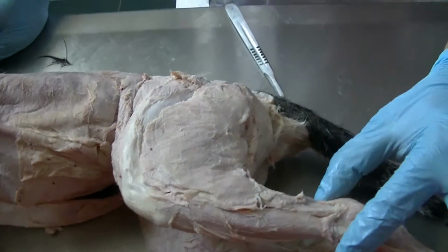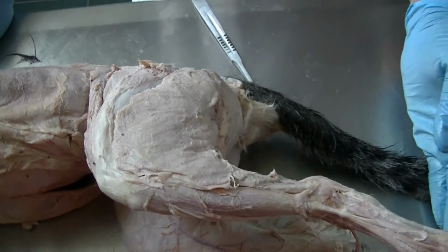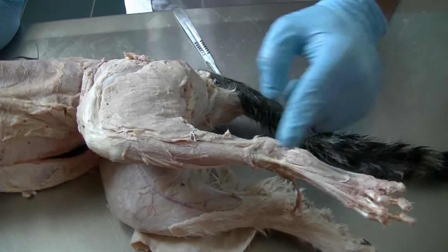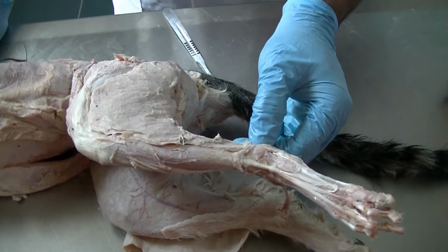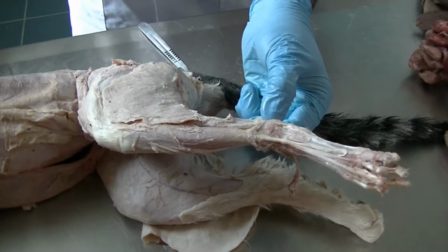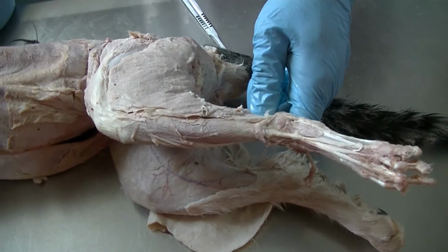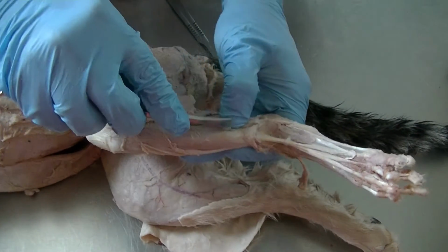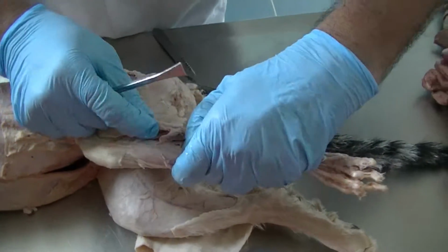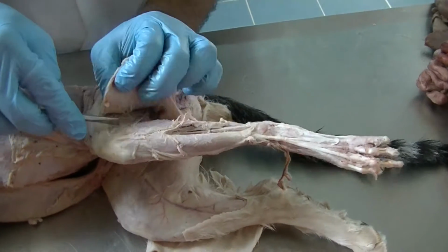As we go to the muscles of the crus of the hind limb, again we have the usual groups of muscles: the extensors of the digit and flexors of the tarsus, flexors of the digit and extensors of the tarsus. Both heads of the gastrocnemius are present, 3 heads of the deep digital flexor, 1 head of the superficial digital flexor, cranial tibial muscle and long digital extensor as well as lateral digital extensor, and peroneus longus are the same as we saw in the dog. But then there is a major difference here.